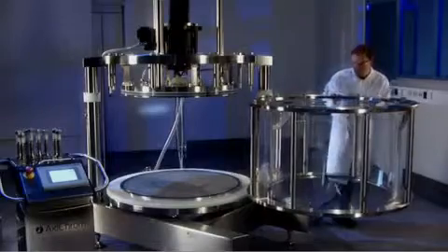Finally, the tube is locked securely in position. Now the operator has free access to the bottom and top bed supports as well as to all wetted seals.